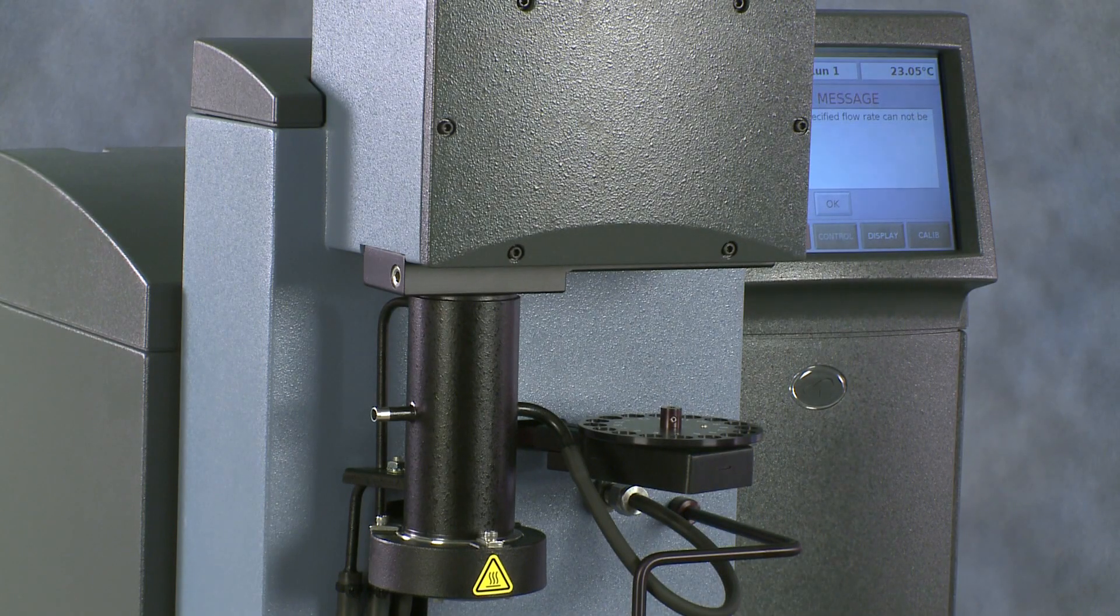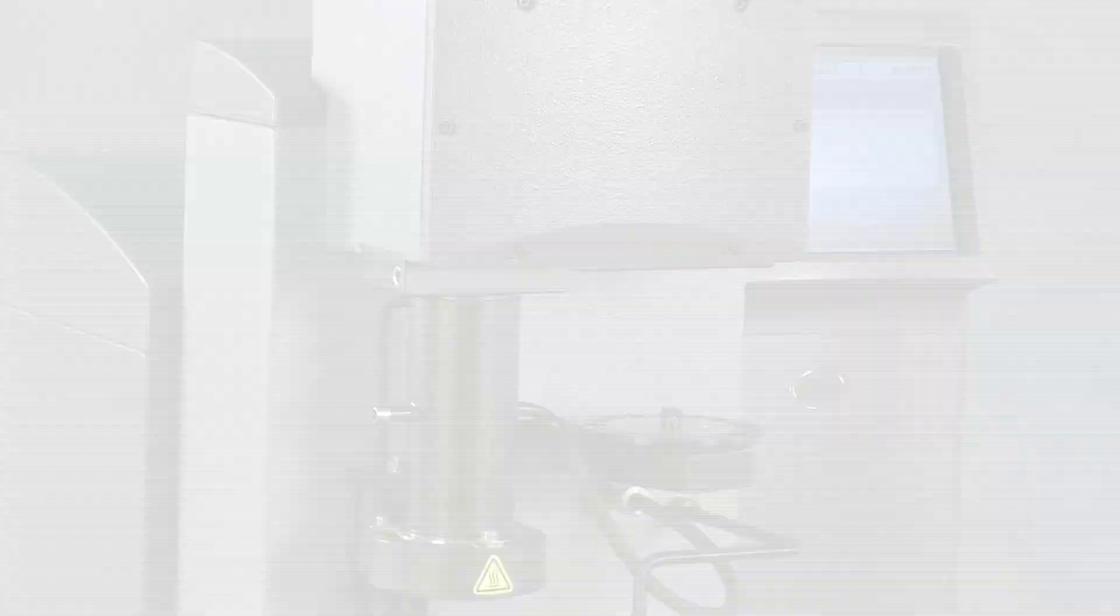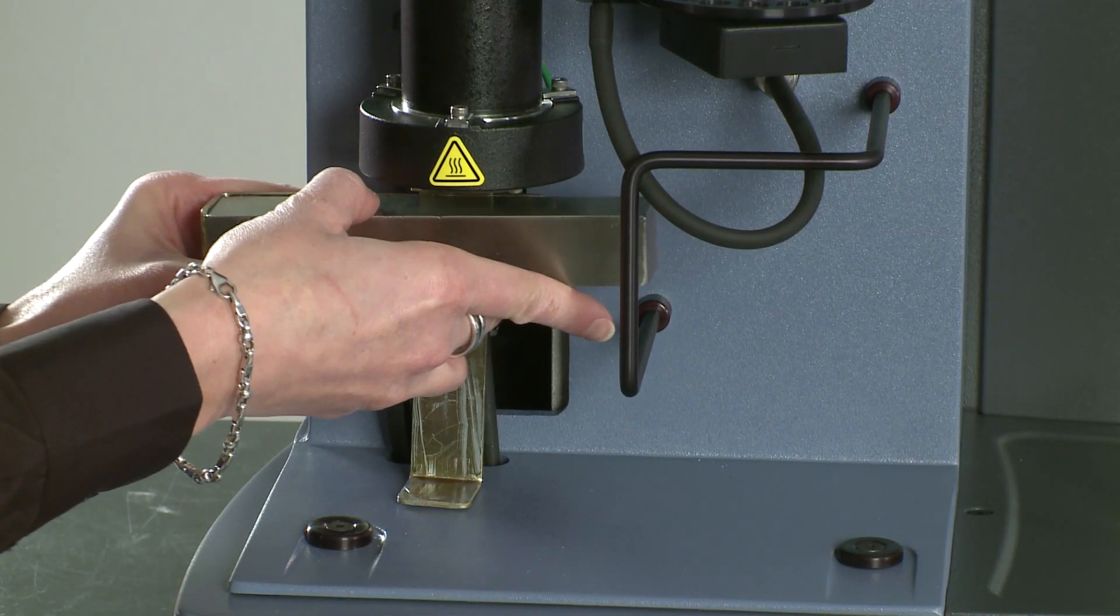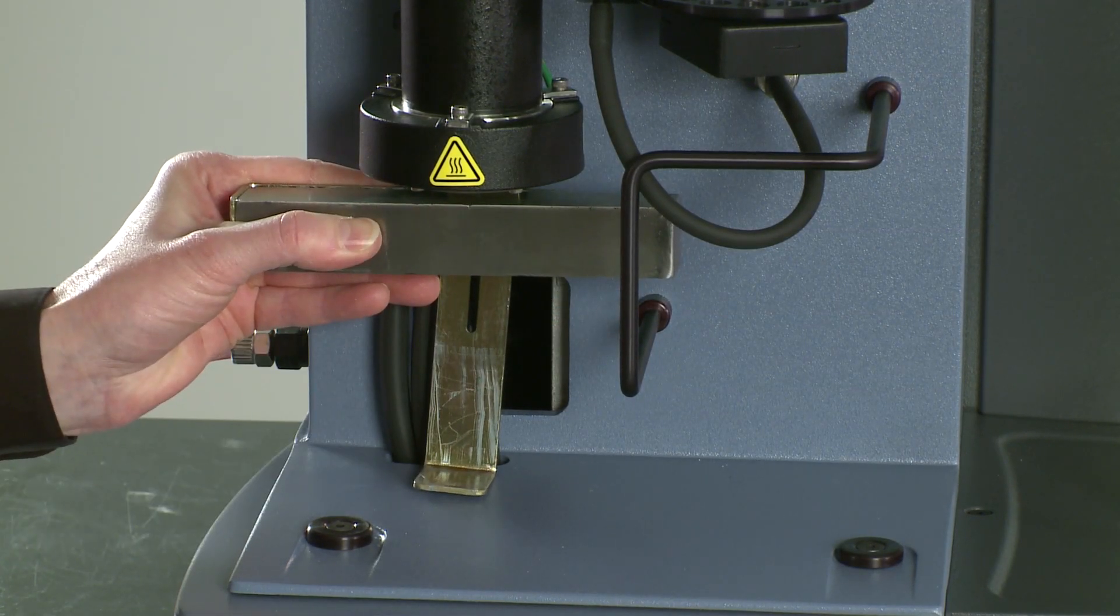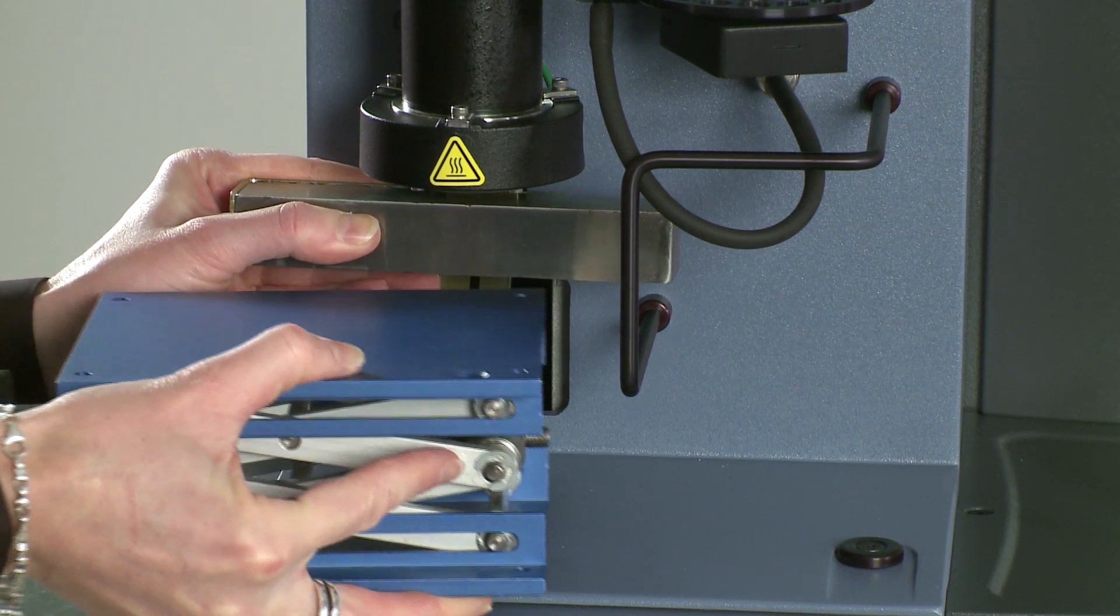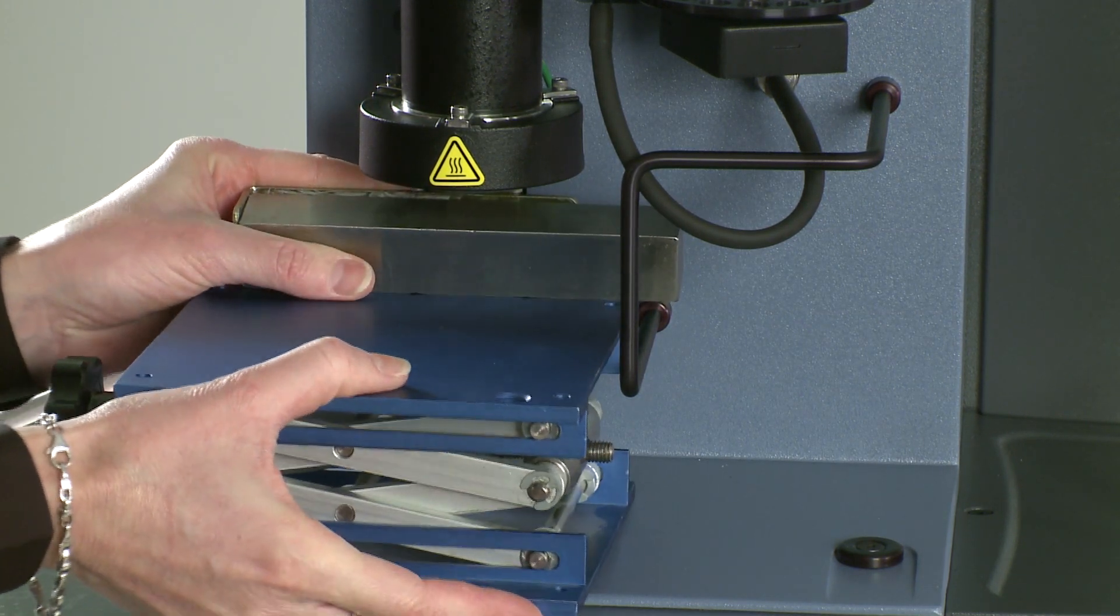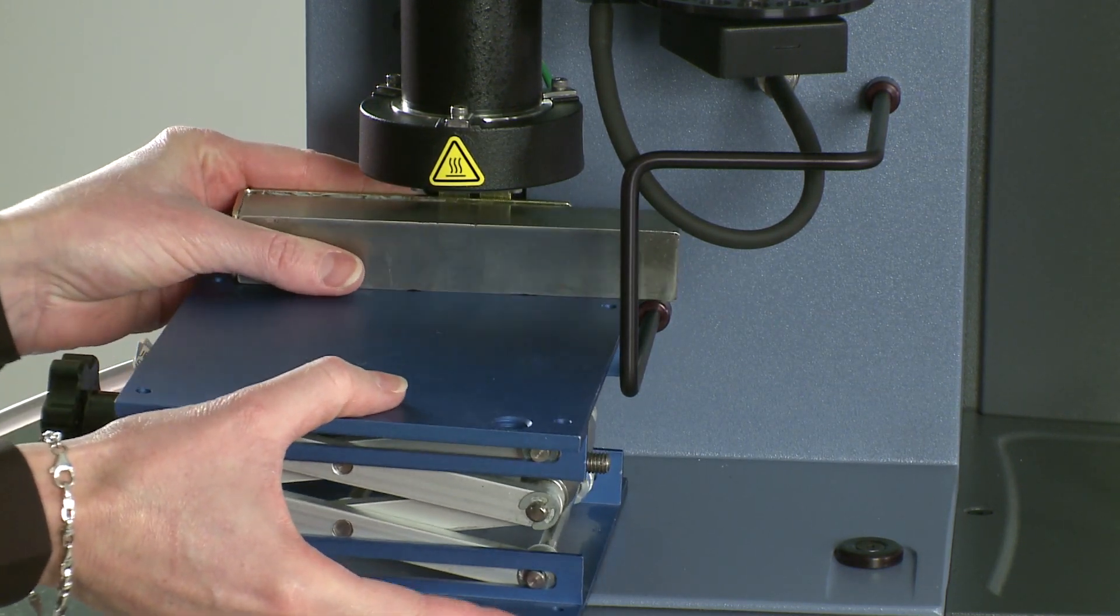Load the nickel sample and make sure that it is lying parallel with the back of the cabinet. Select Start to begin the calibration run. Slowly raise the magnet under the furnace. Make sure that it is secured in this position and that it is not touching any of the tubings.